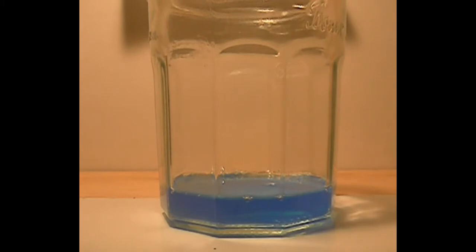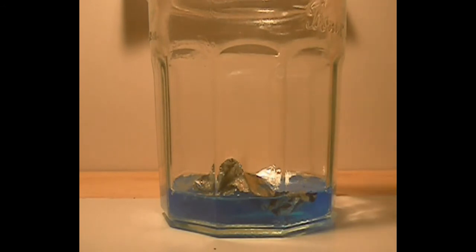And put the aluminum in here. I'll put a larger amount than the other tests, so hopefully we get a big yield in the end. Let's just chunk this all in, scraps of foil, bits off cuts of cans.